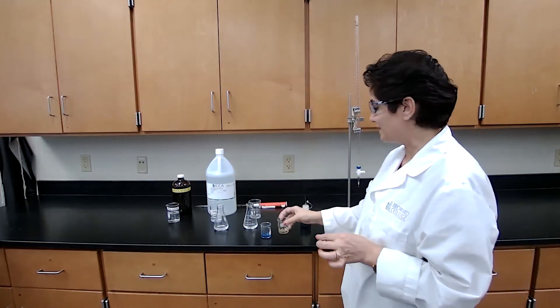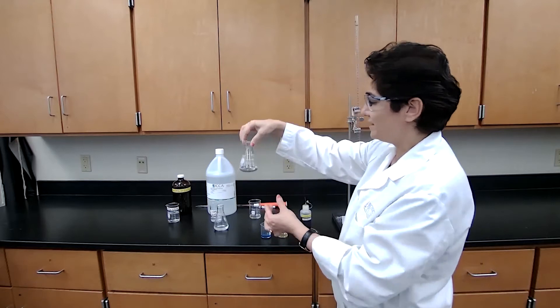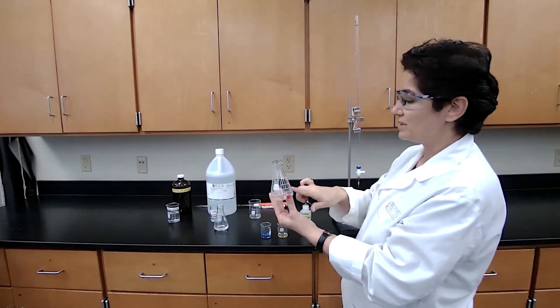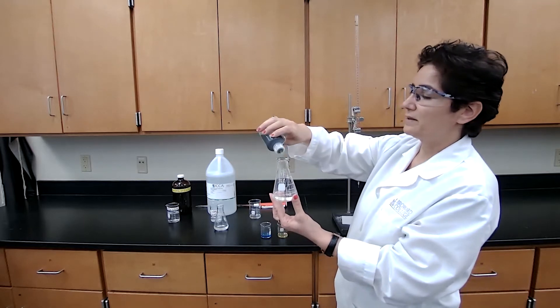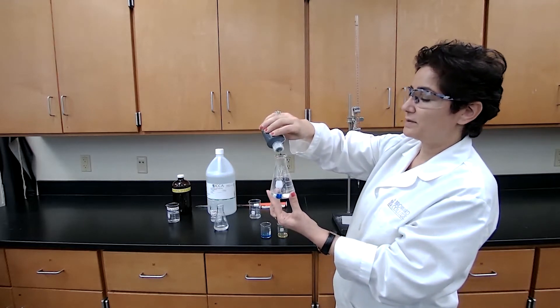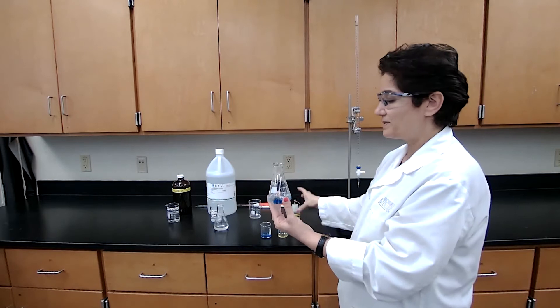So what I expect when I have my calcium hydroxide solution in the flask is showing a blue color. So I add a couple drops of that.